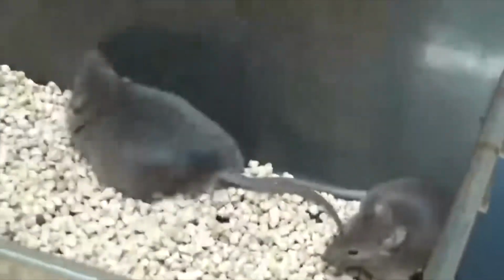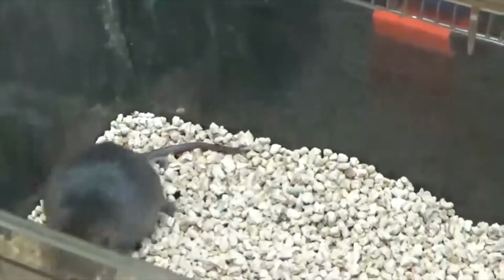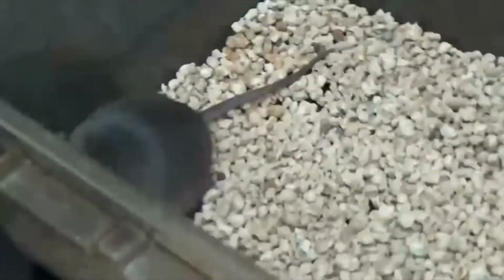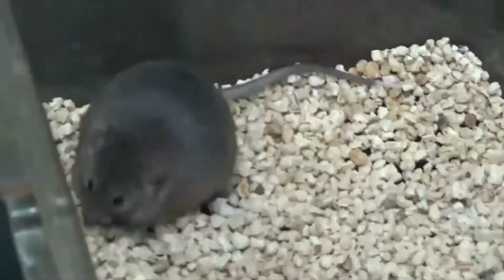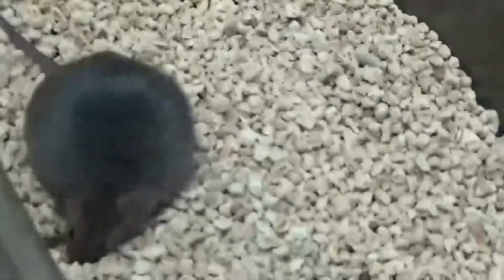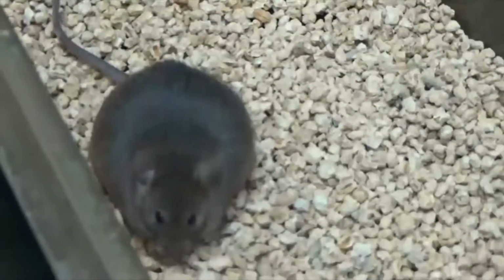So this one is the obese mouse and has very high blood glucose levels as compared to the other mouse. So this obese mouse can be used as the model for diabetes, to get a detailed understanding of diabetes, as well as to develop drugs targeted against diabetes.